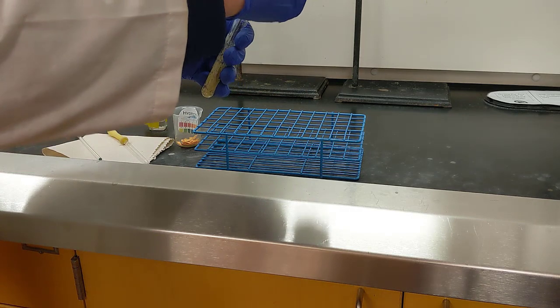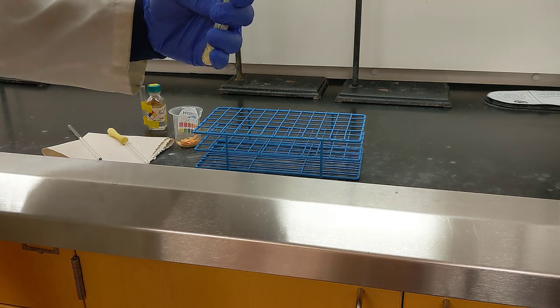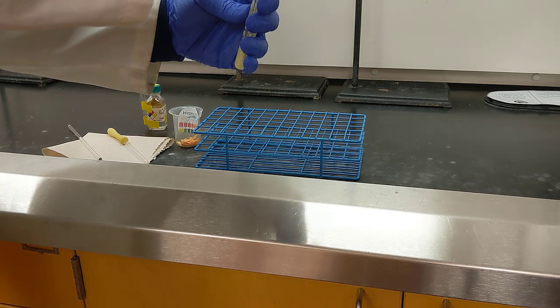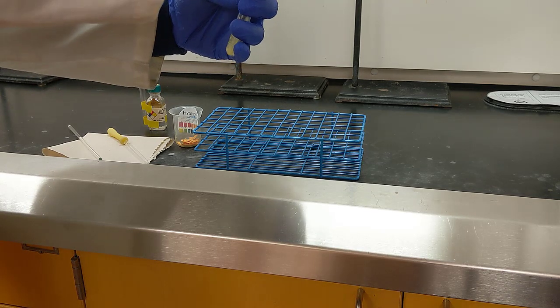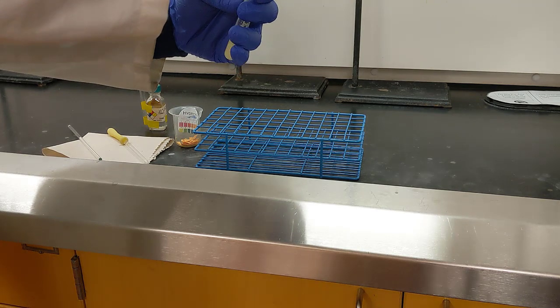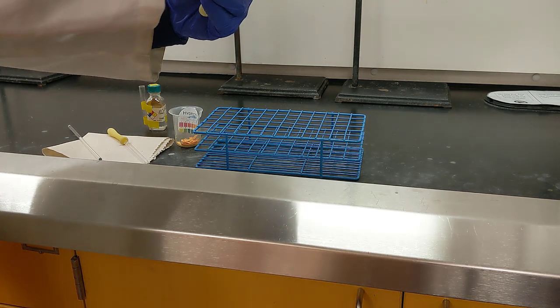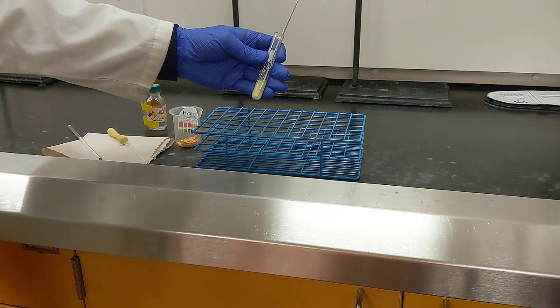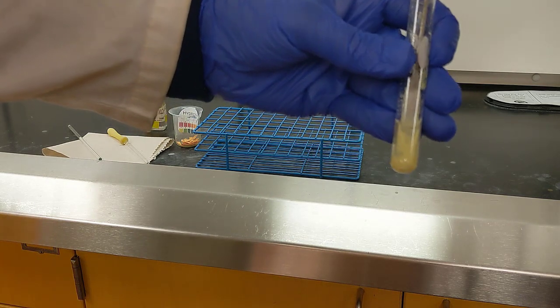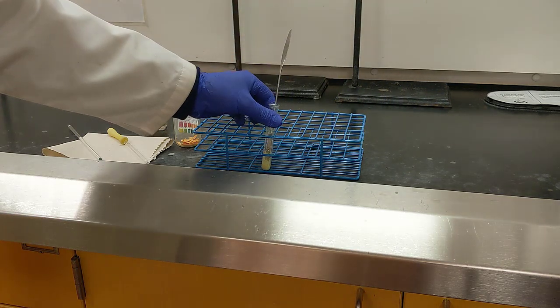Alright, so I've got my hydrochloric acid in there. Now I'm going to try to mix this all around, because I know some of that sodium hydroxide could be kind of lodged on the sidewalls or in that solid product. So I'm just going to go ahead and briefly mash this together, and then we'll check the pH here in a second to see if the pH is in fact acidic. Alright, so I've mashed it up pretty good. I've got this kind of heterogeneous mixture of yellow powder in this clear solution. Let's check the pH.